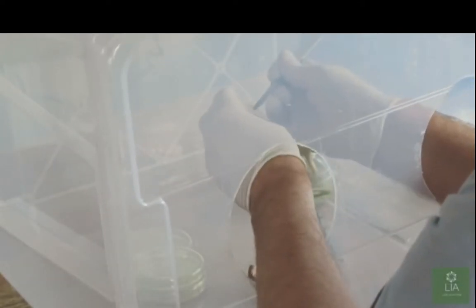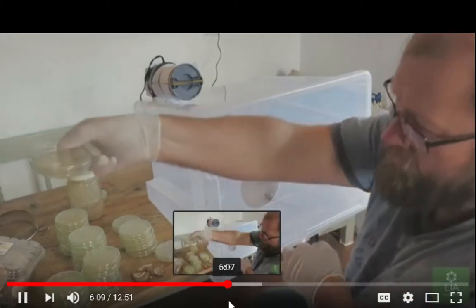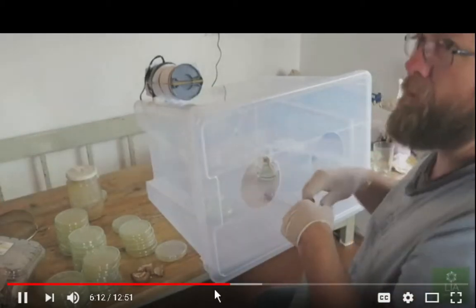God, what if that flame just grabbed a hold of the alcohol in his glove? You know, like that whole glove would just light right up. That just scares the living crap right out of me. Let's check this in here. So somebody wants to write on what that mushroom was, put on, and put the date on.